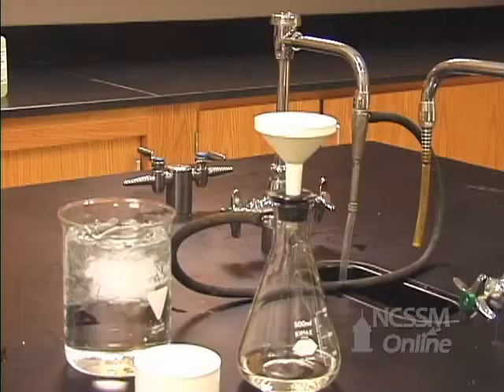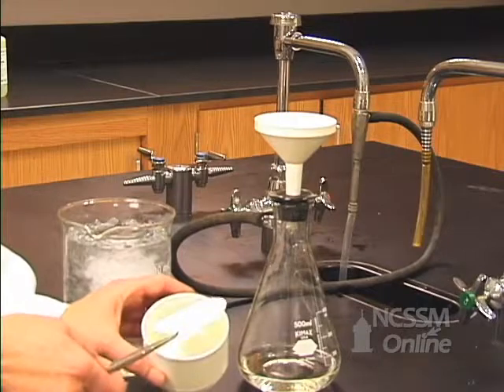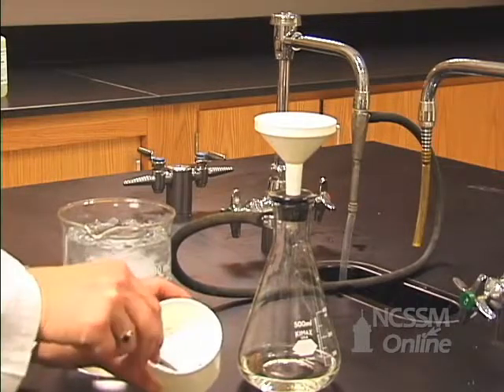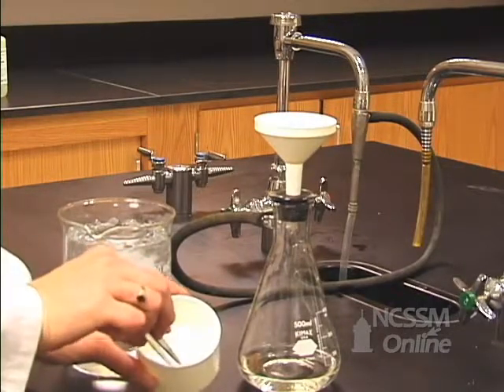I'll place my weighed filter paper in the funnel and set up my filtering apparatus again.